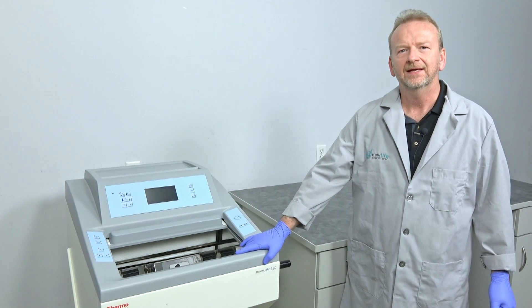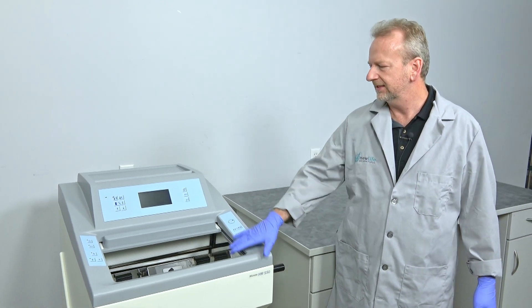Hi, I'm Rich at New Life Scientific and today I'm going to demonstrate on this HM-550 cryostat how to remove the cutting assembly.